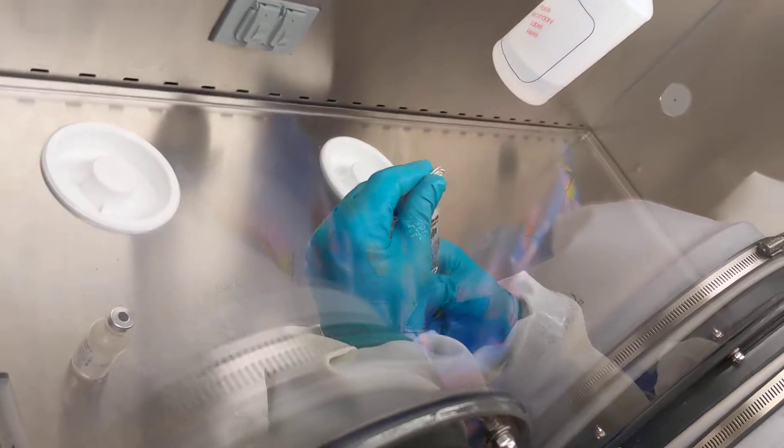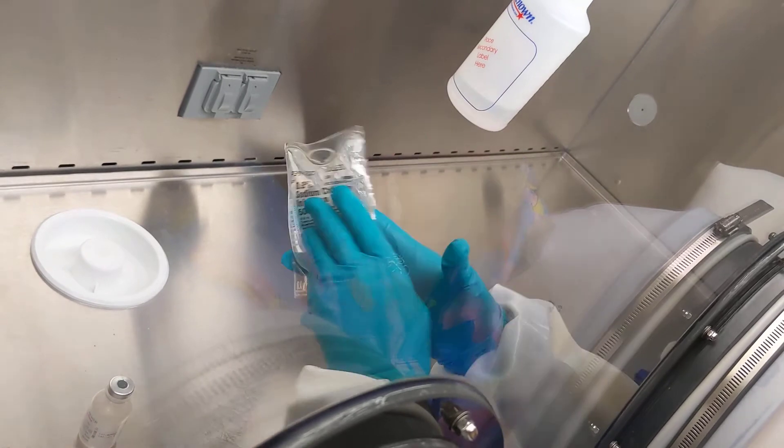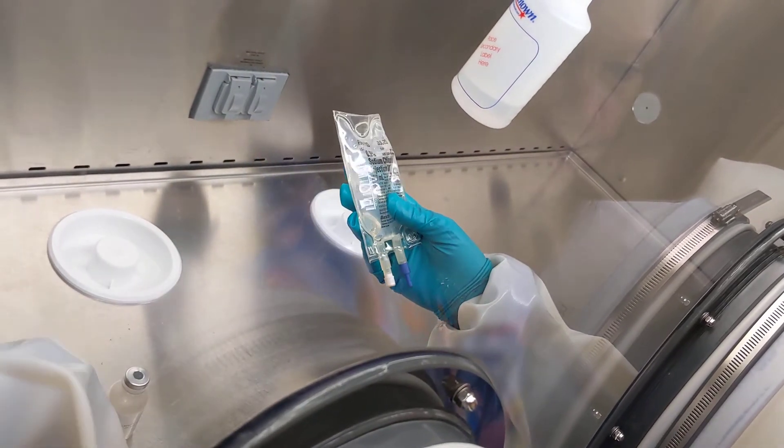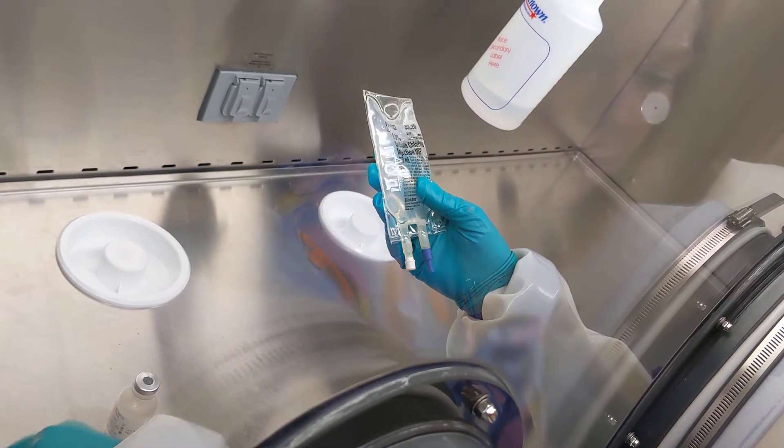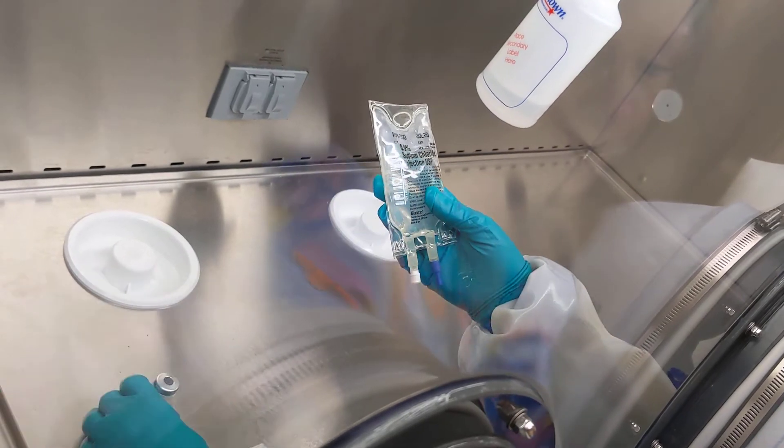You also check that something hasn't gone wrong and interacted, creating solids in here. This is mixed and ready to go, so everything goes back in the inner chamber.